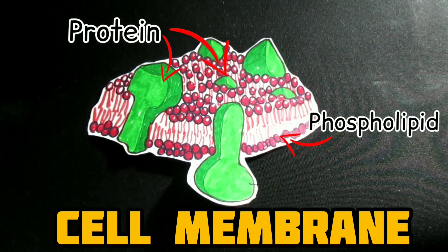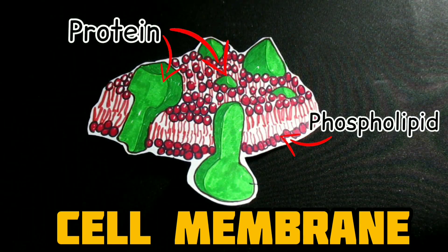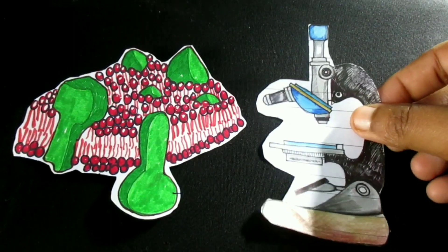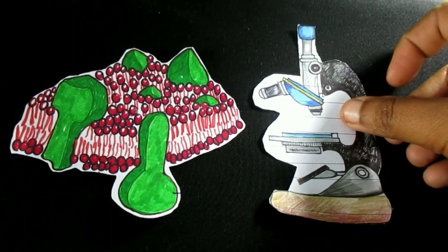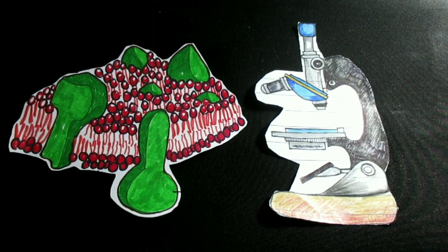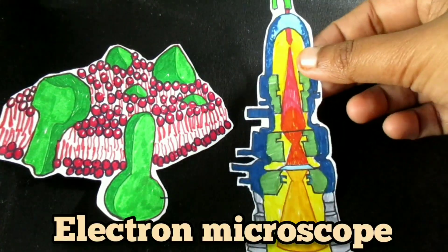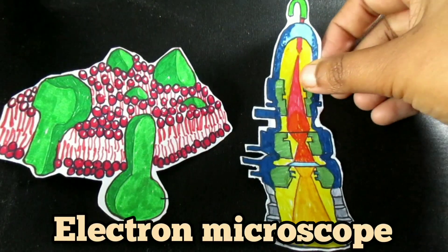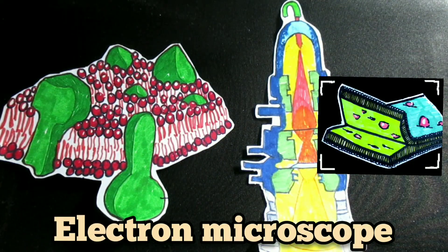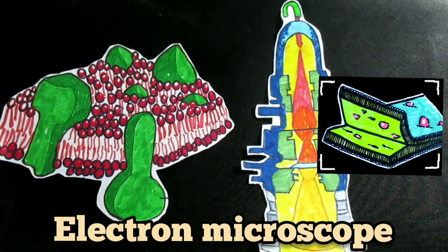We already know cell membrane consists of phospholipids and attached or embedded proteins. Membrane proteins play vital roles in the metabolism and life of the cell. You cannot use an ordinary microscope to visualize or characterize these membrane proteins. Using the freeze fracture technique in electron microscopy, it is possible to split a frozen cell membrane apart, allowing visualization of the membrane structure and the organization of proteins within the sea of phospholipids.